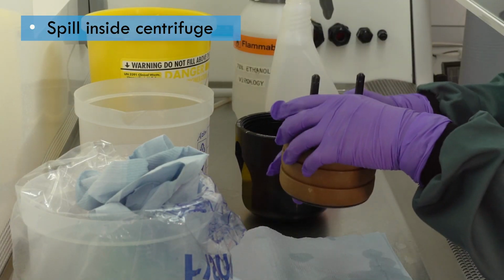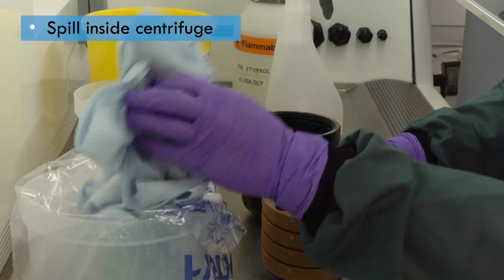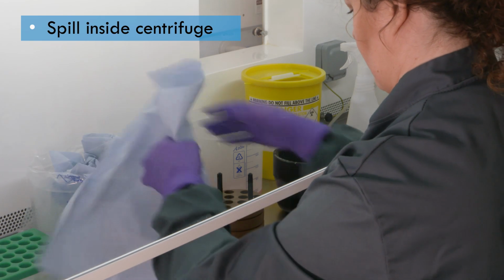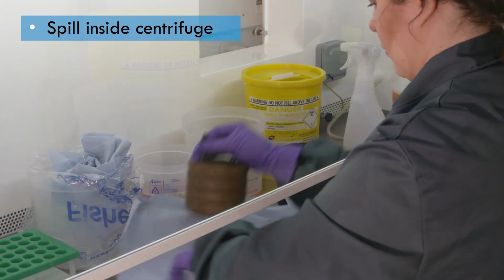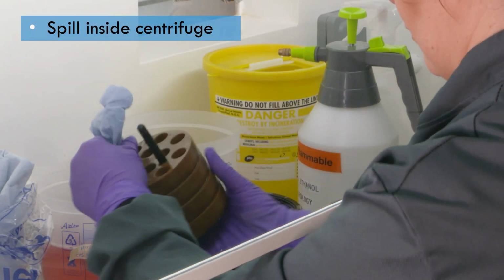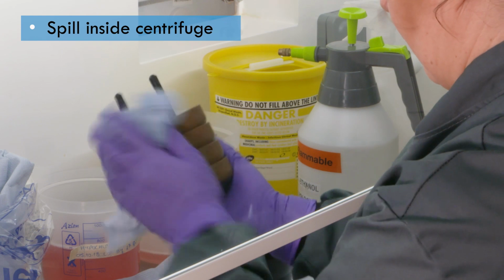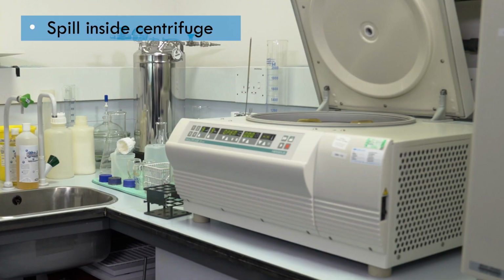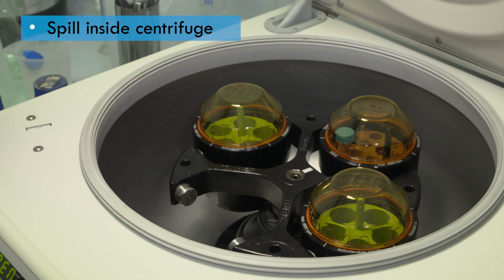Mop up any remaining disinfectant using absorbent tissue and place in a suitable container for autoclaving or immerse in disinfectant. Remove any chemical residue with ethanol or water and dry thoroughly. Check the bucket or rotor and the centrifuge for any signs of damage. If it is damaged, ensure it's not used and contact the supplier to arrange repair or replacement. A service visit may be advisable, even where there is no obvious sign of damage.